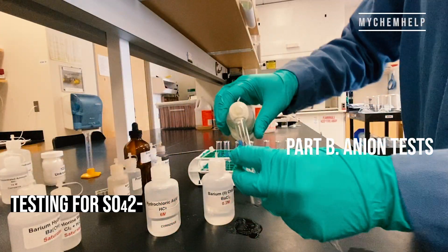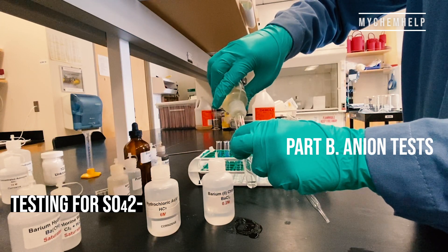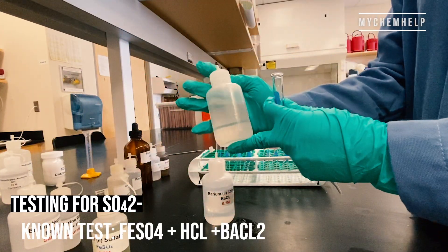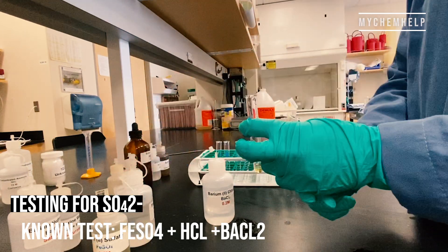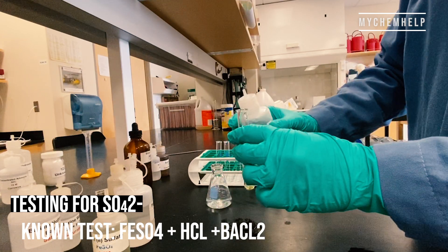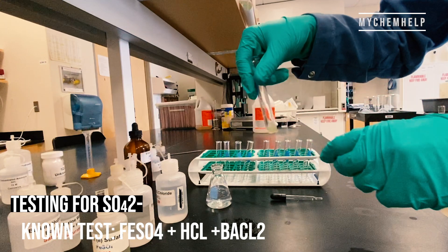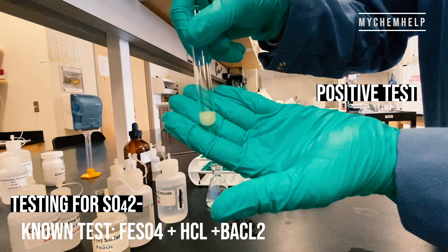Back into the lab for part B — we have the anion tests. So here we're looking for sulfate ions. Our known test is going to be iron sulfate plus barium chloride plus HCl, and that white precipitate tells us that is a positive test.